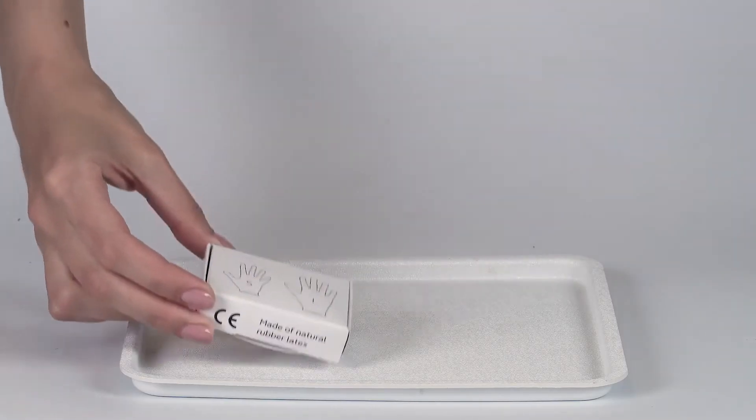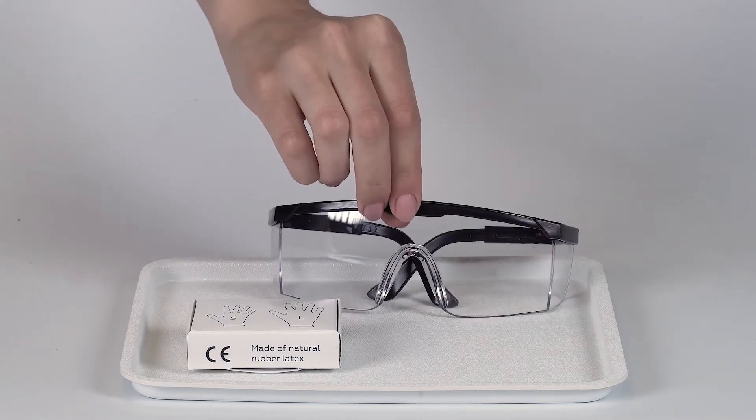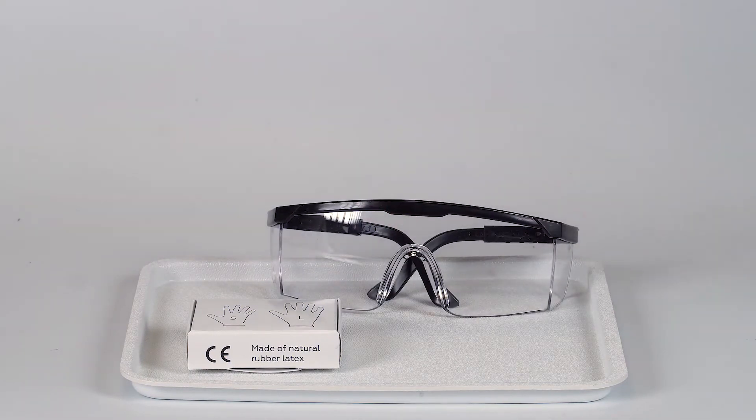Perform this experiment on a plastic tray to contain any possible spills. Don't forget to put on protective goggles before performing the experiment.